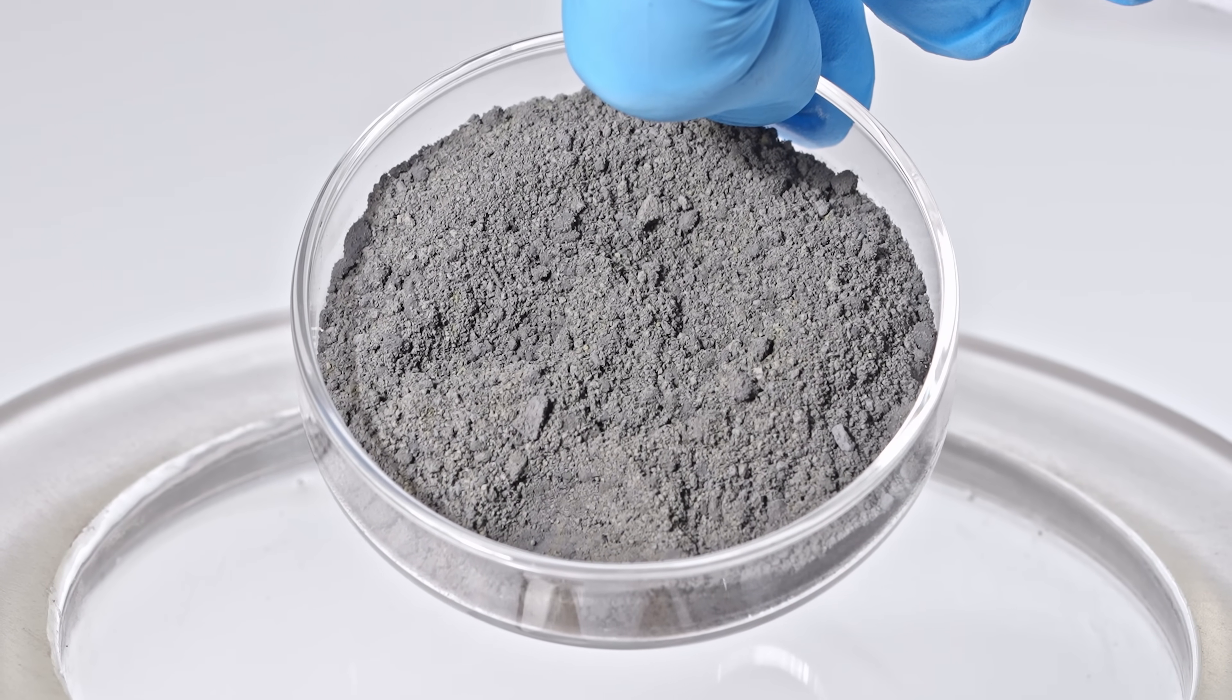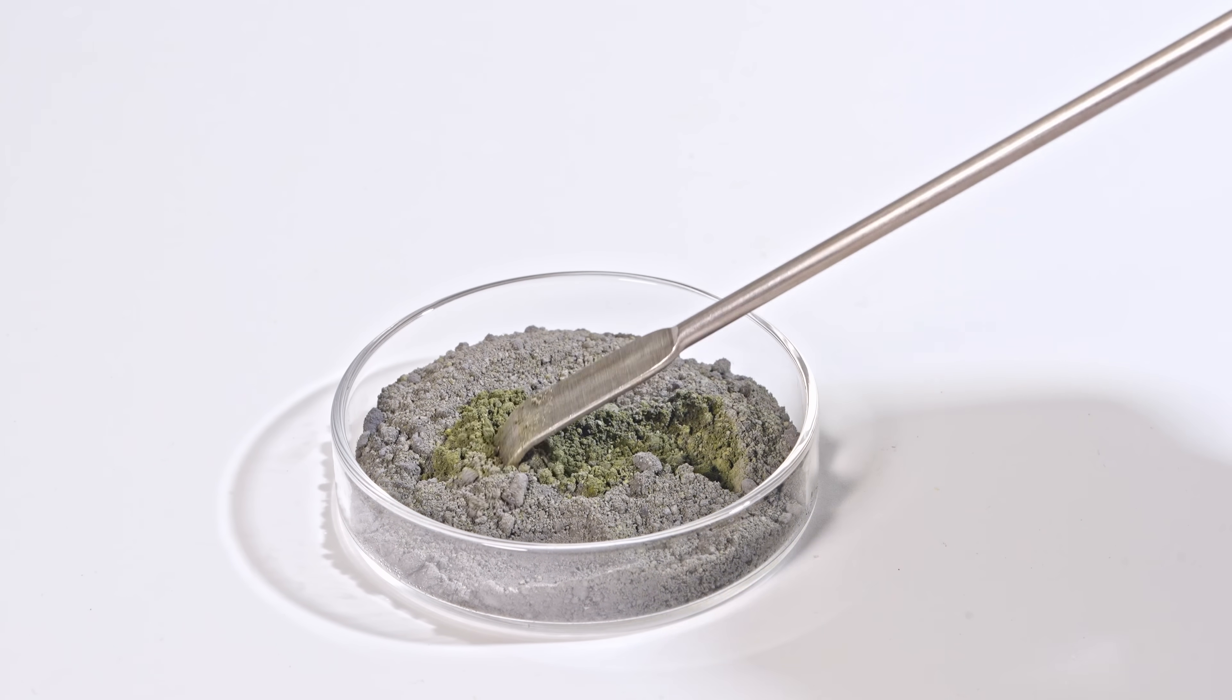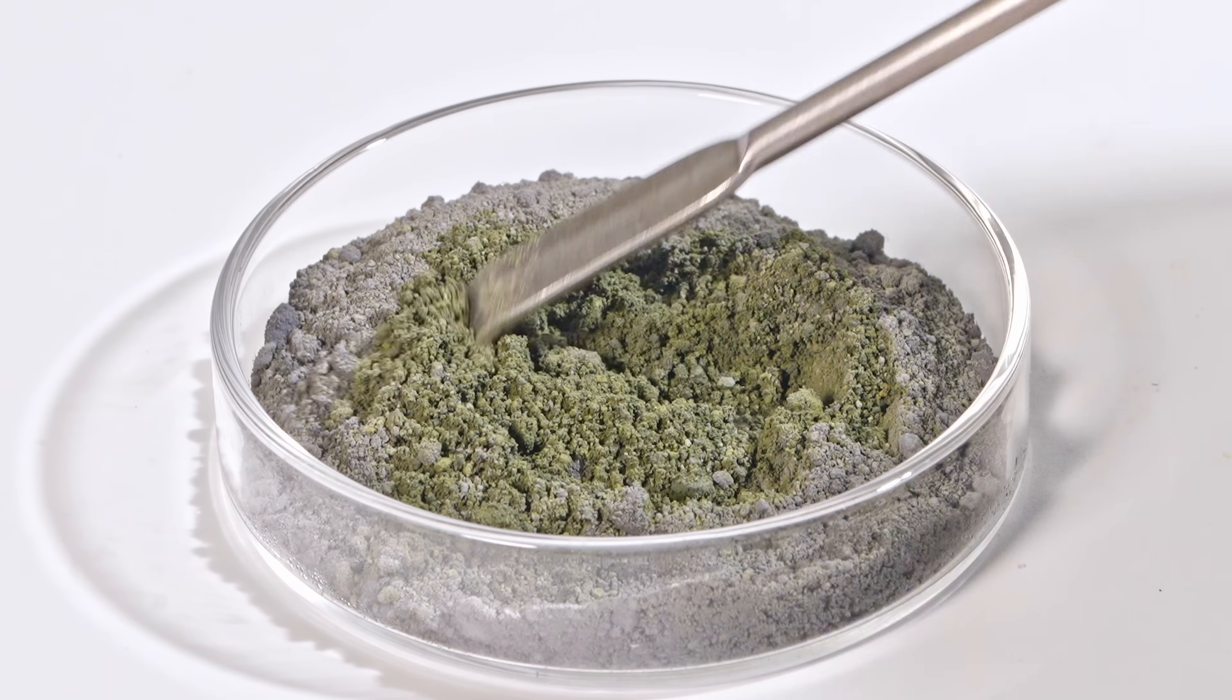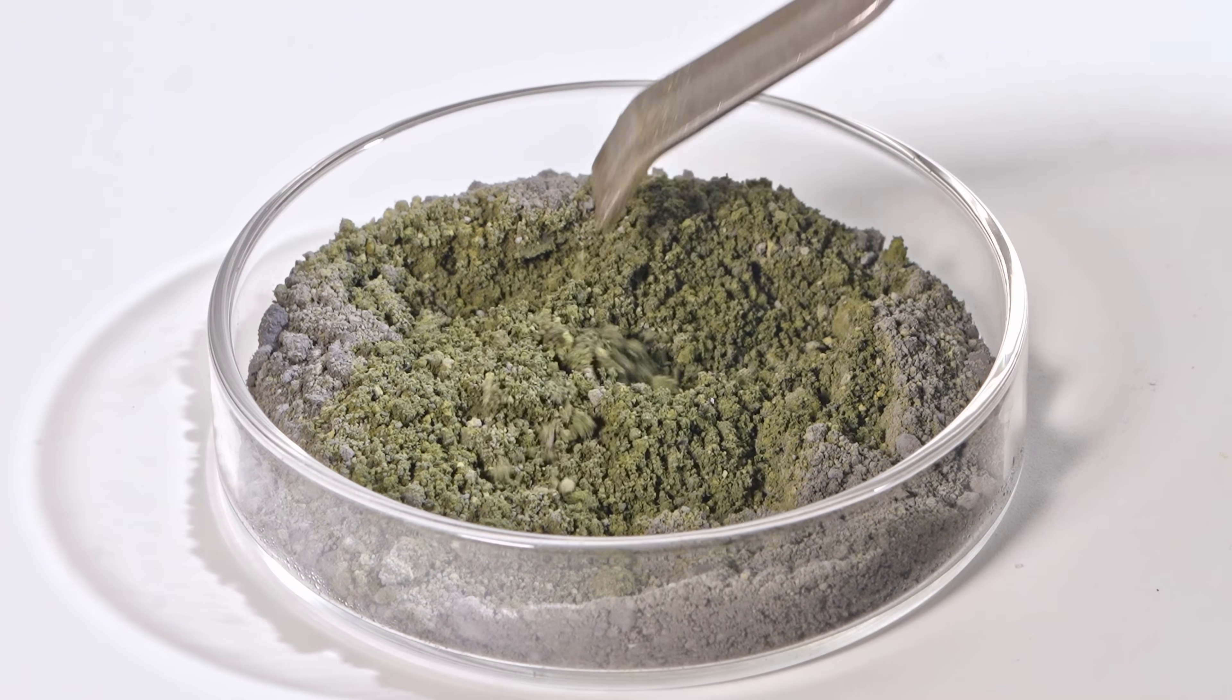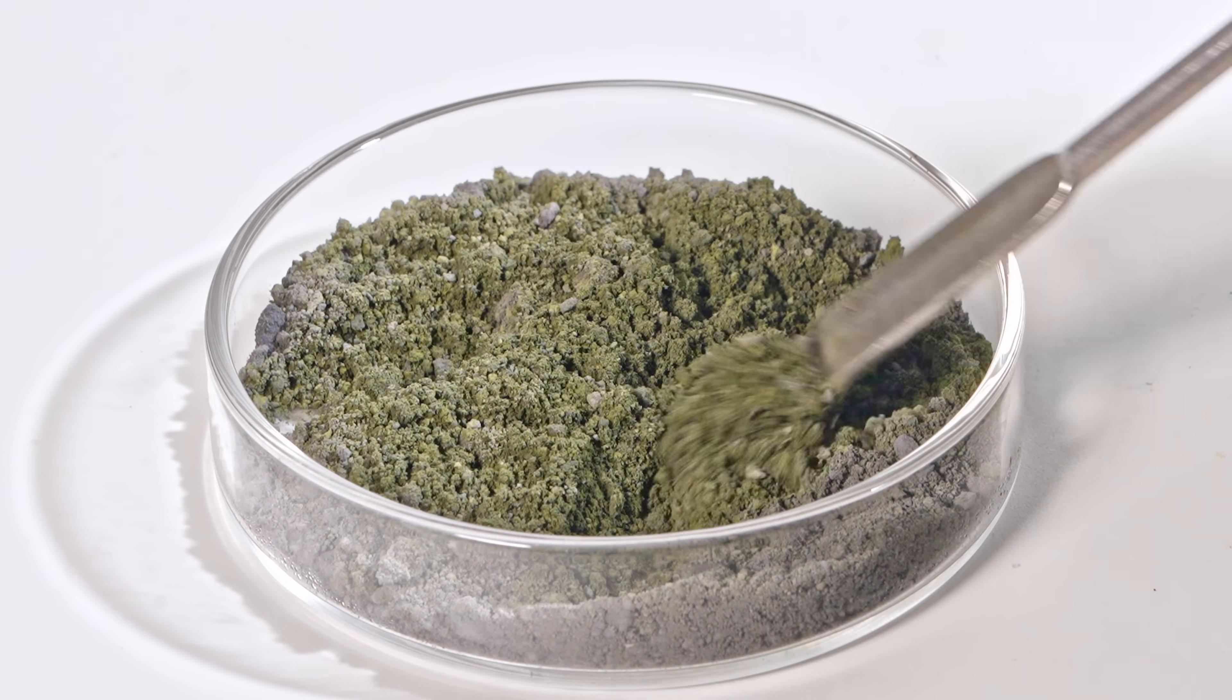Mine turned out green, though some sources say it can be yellow or golden. It probably depends on how you make it, but I only tried it once and it was green.